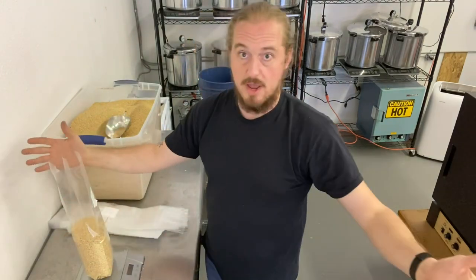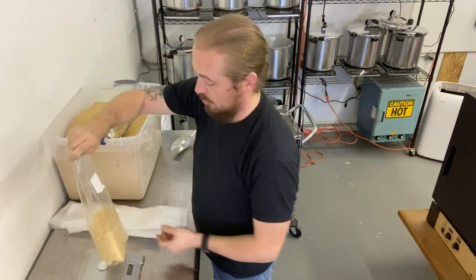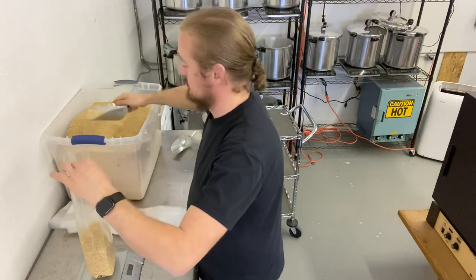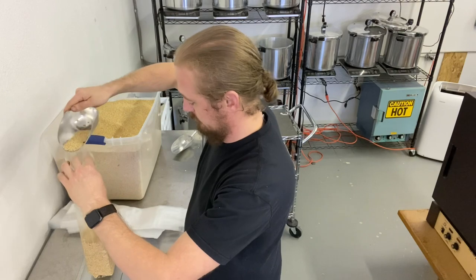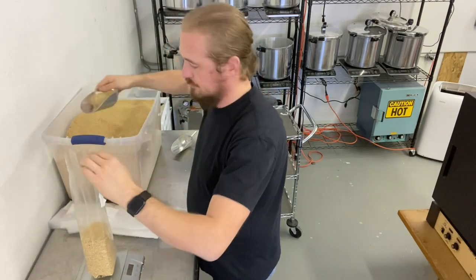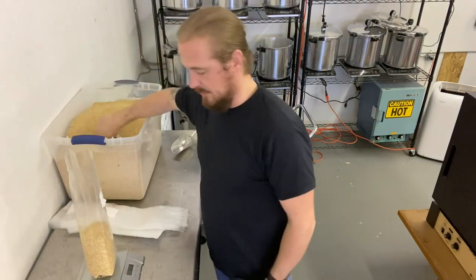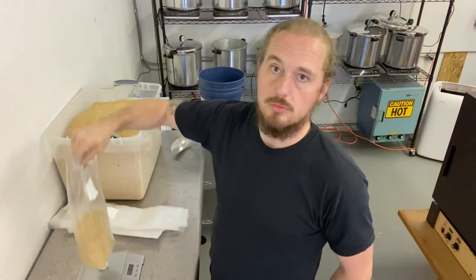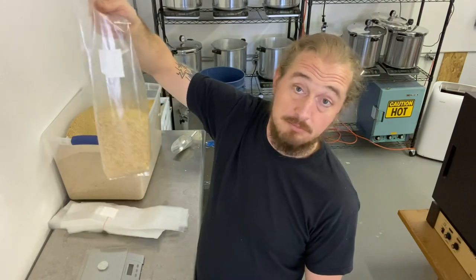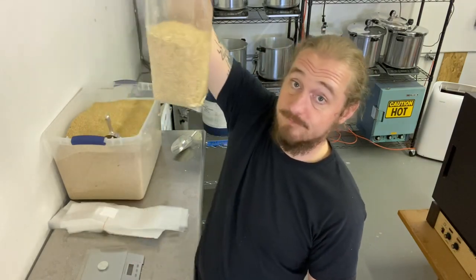That came out at 1,151 - I'm going to pour some out. 1,020 grams. Doesn't have to be precisely 1,000; a little over is okay. Never under 1,000.